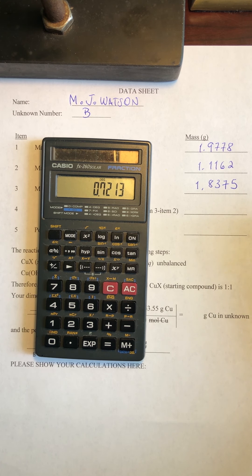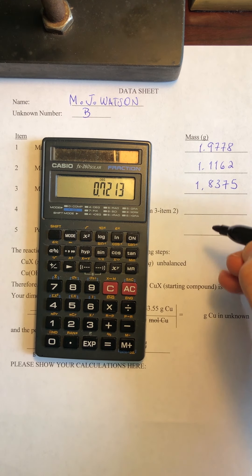not try to blot it out or use white paper or anything like that. Now, for the purpose of this video, because of resolution, I'm going to be using a marker to write these things down.